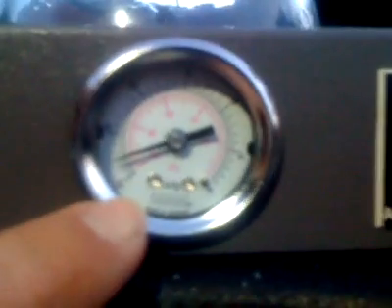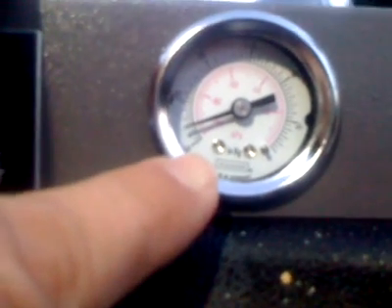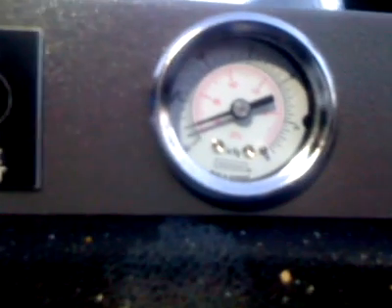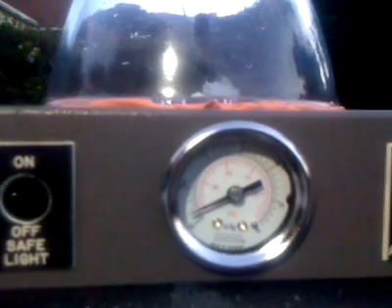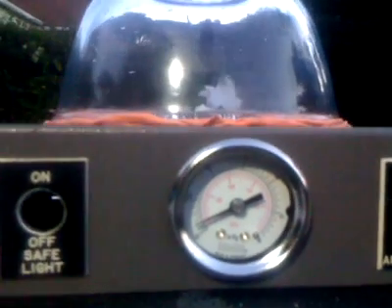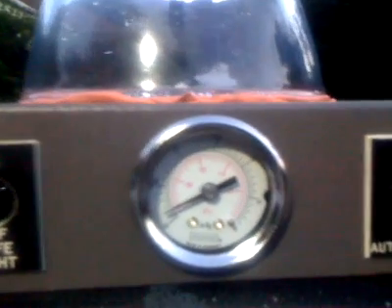And now we are at the last mark, there is minus 30, so I make that 28 inches mercury, just over 28 inches. From what I'm reading, minus 30, or 29.97, is a complete vacuum. But from here on in, it takes an awful lot of energy to go the whole hog, and you need very expensive, clever pumps to do it. So if I take a look in here now, I don't know if you can see, there's some little bubbles now, just along the edge of the water that I dropped in there.